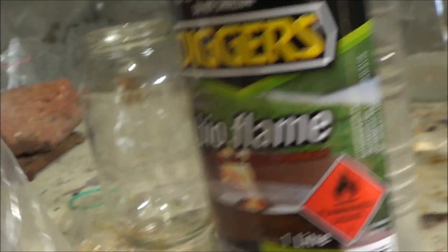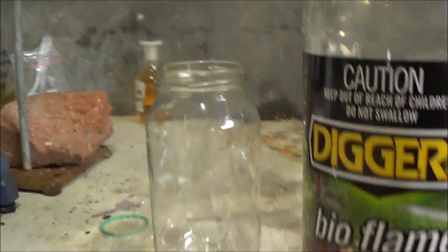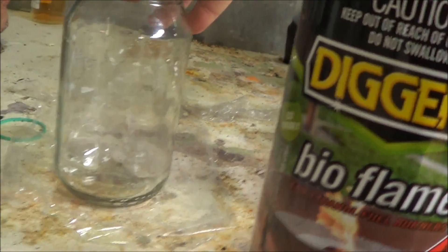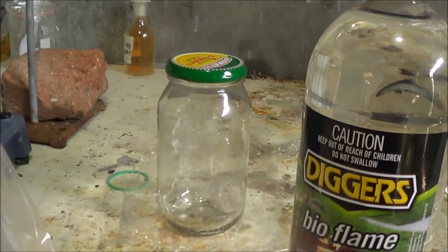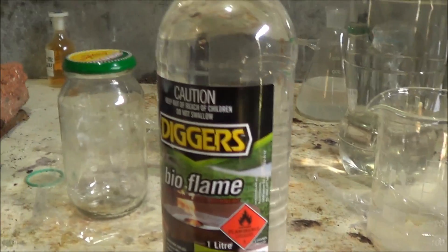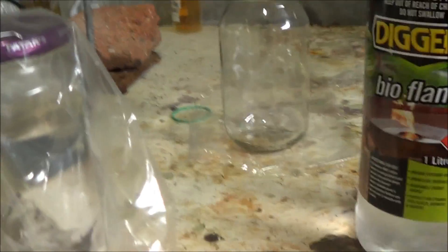So we're going to be doing this in a pre-dried jar. I know I get a bit of crap for doing stuff in jars and plastic containers, but it's really done for convenience. Because once this reaction is done, I can shut it up and leave it to when I need it. Because I don't actually own the nitromethane yet. I should be getting that soonish. And then I can store it pretty easy.